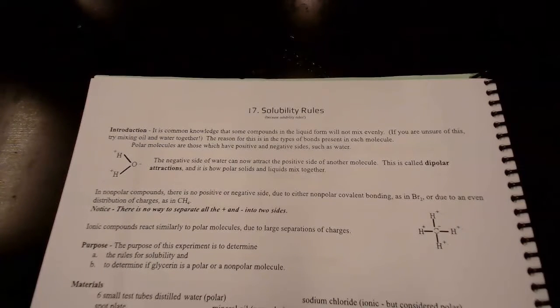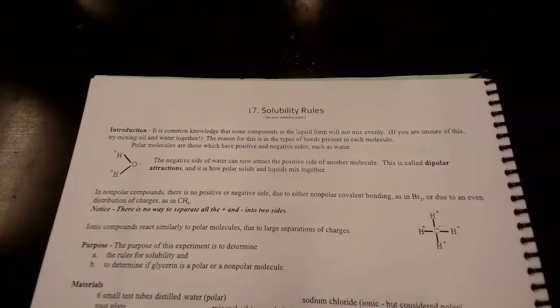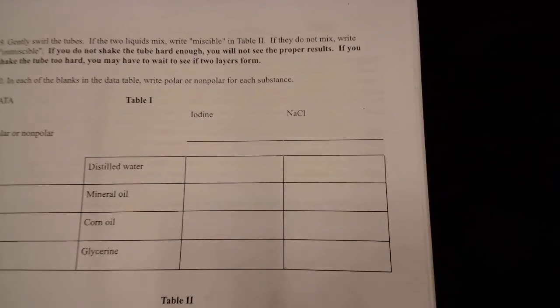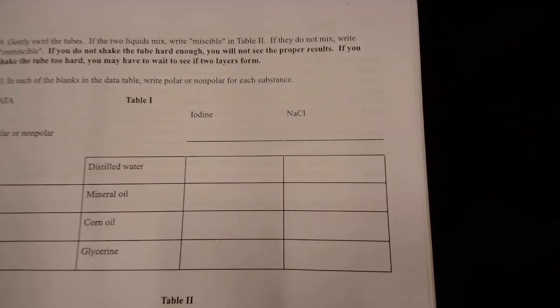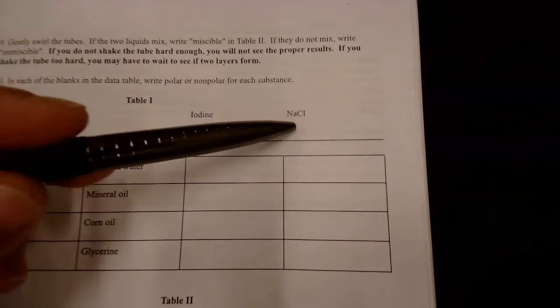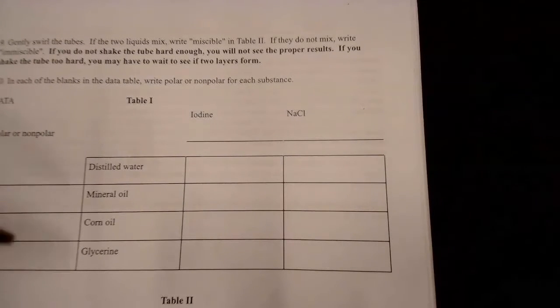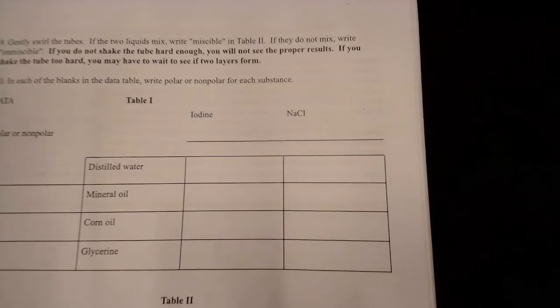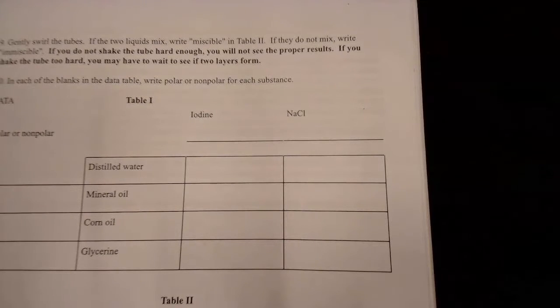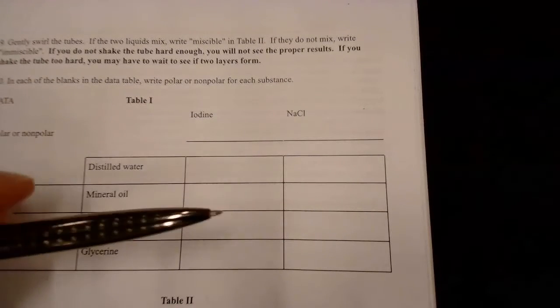In the beginning part, you can see how it describes what a polar and a nonpolar molecule is. On the next page we have these charts. You're going to write down whether you think these chemicals are polar or nonpolar — just look in the materials section, it'll tell you which one's polar and which one's nonpolar. Then we're going to mix them together.